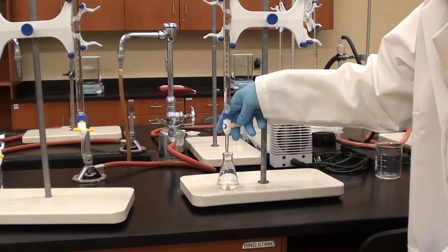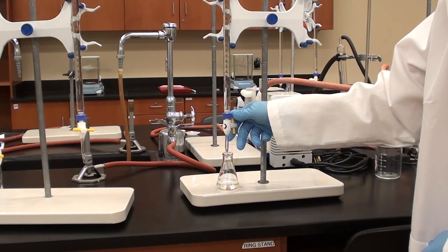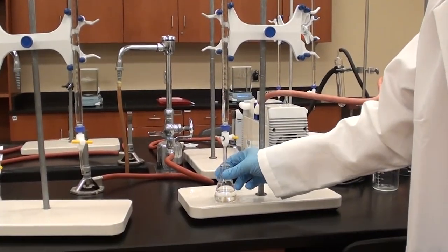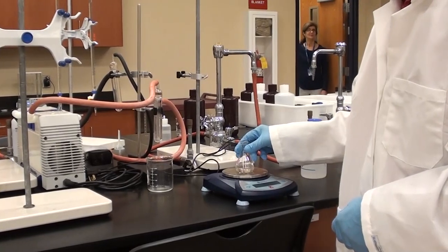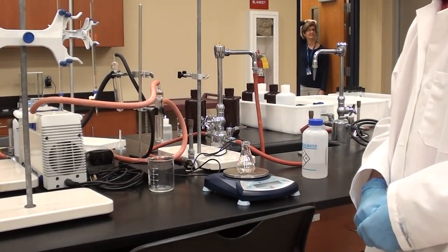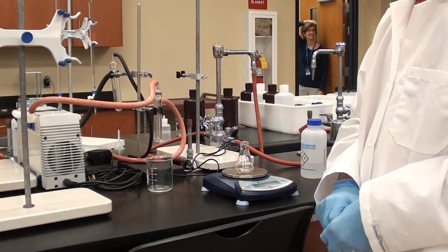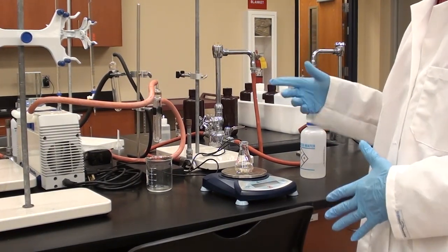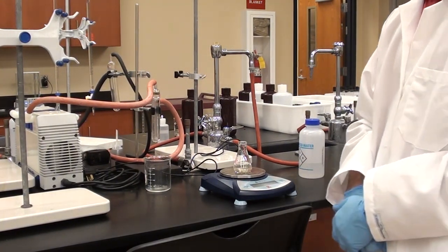And this should be the last addition. Yeah, last addition now. And, again, we'll get an accurate measurement to two decimal places, whatever volume that happens to be. Then we'll pull that over and we will do the mass again. Again, no taring between additions. It is important that, when you're doing this experiment, that you have your balance readily available so someone else does not interfere.